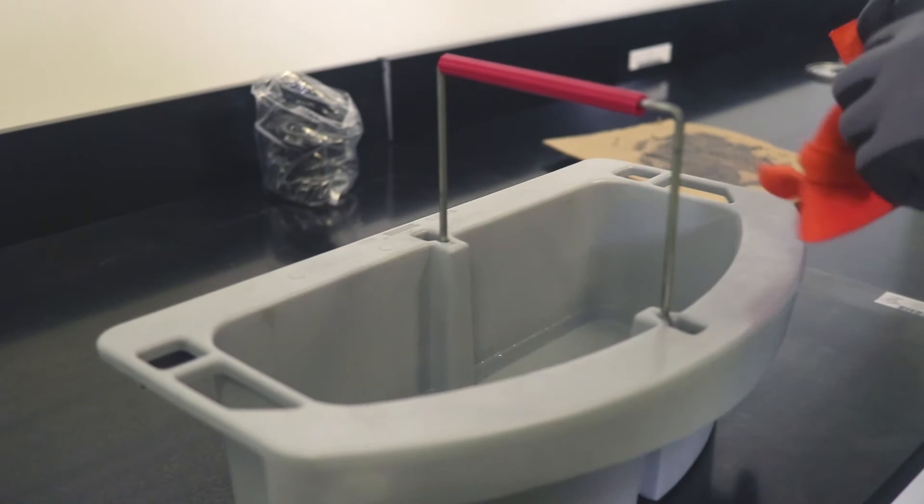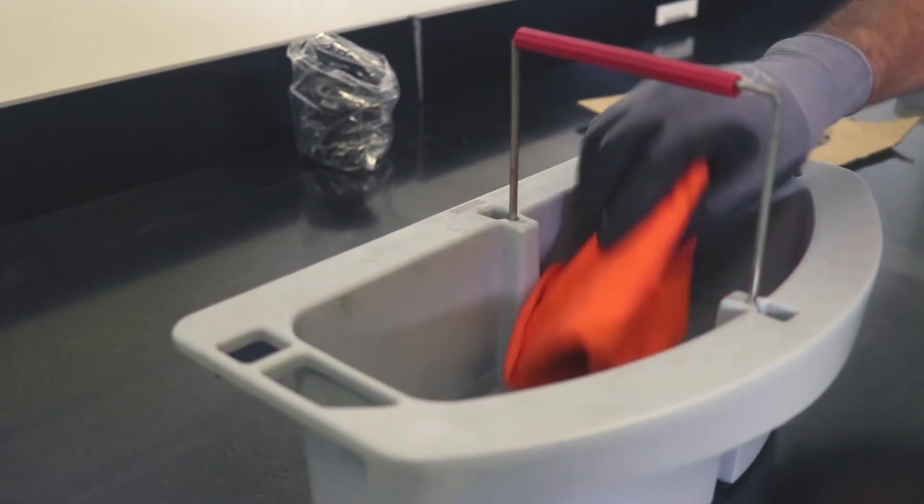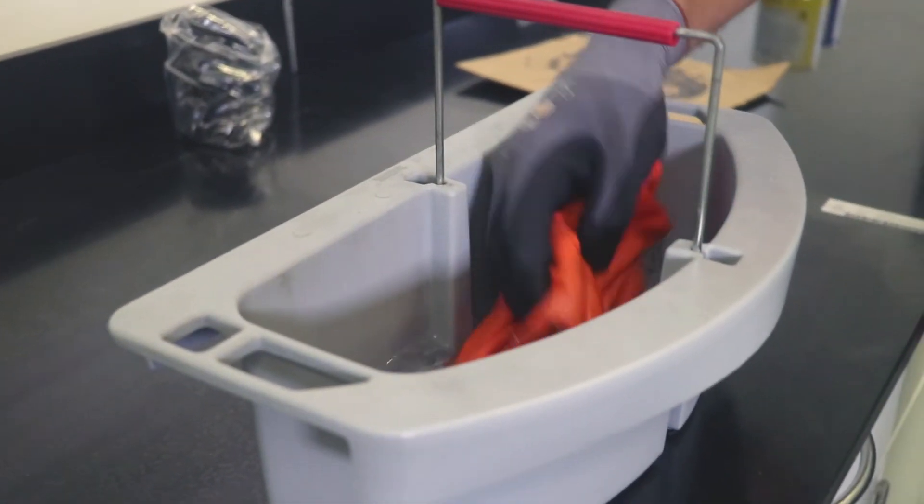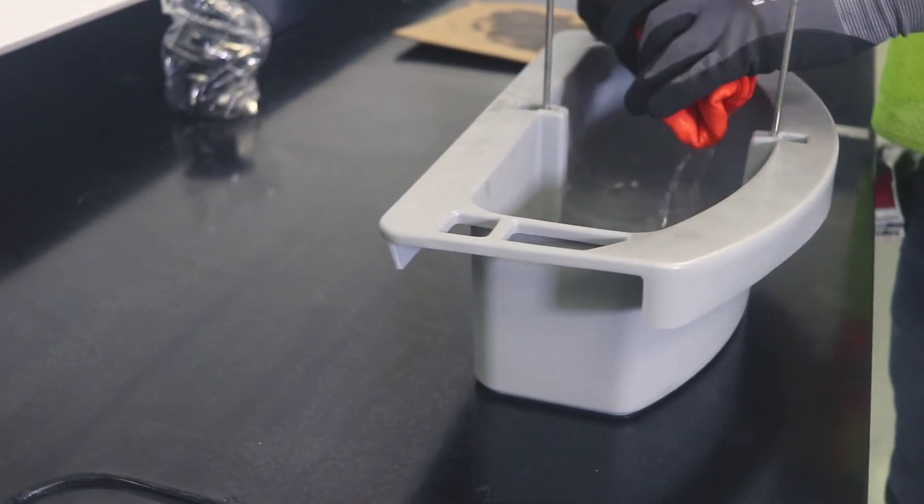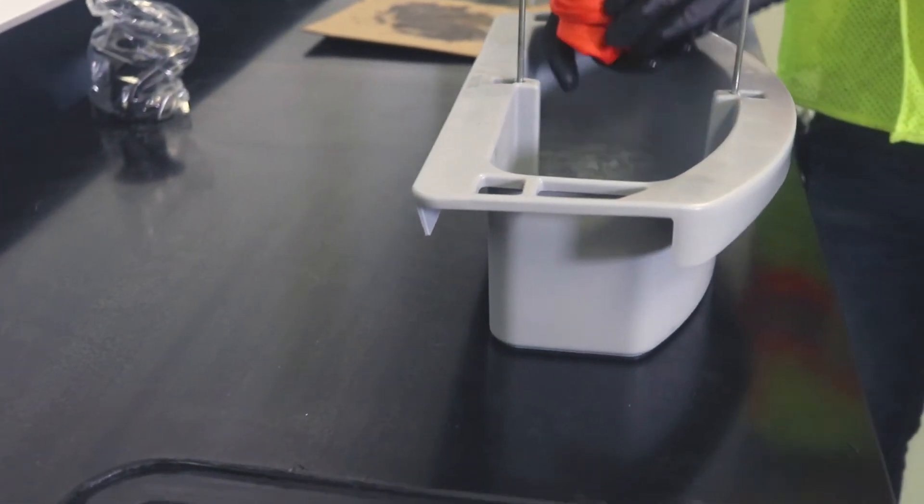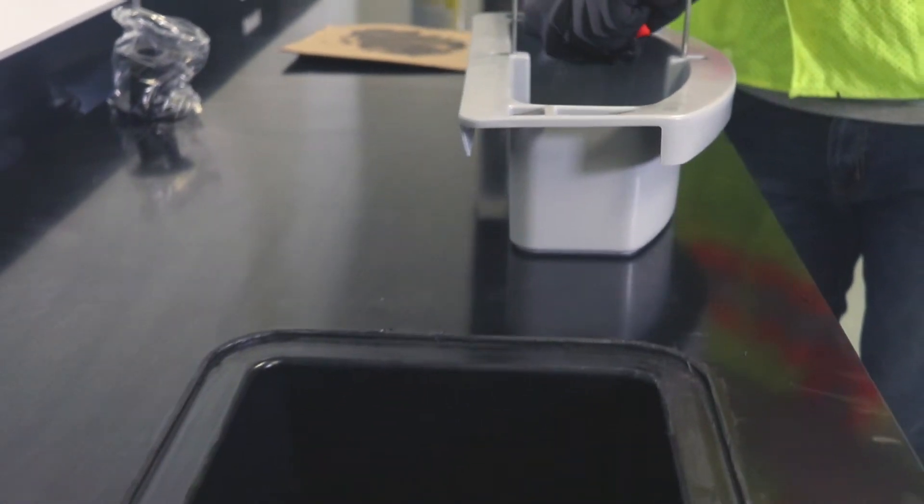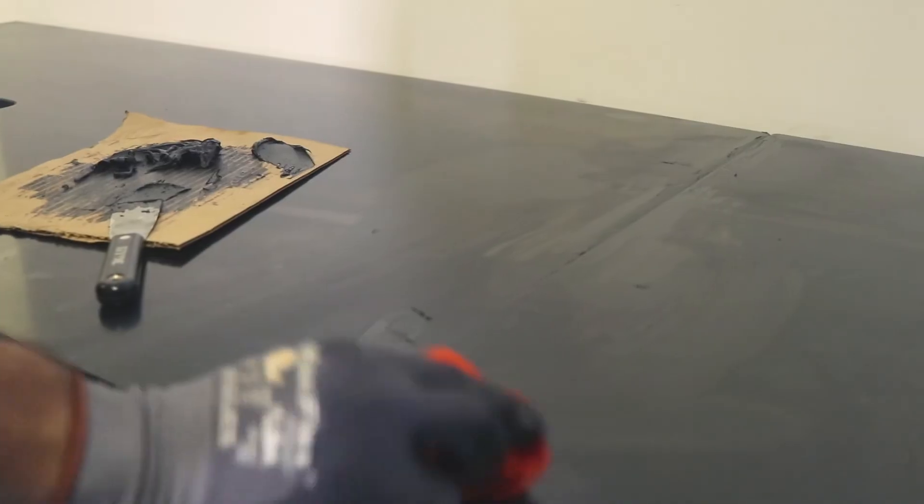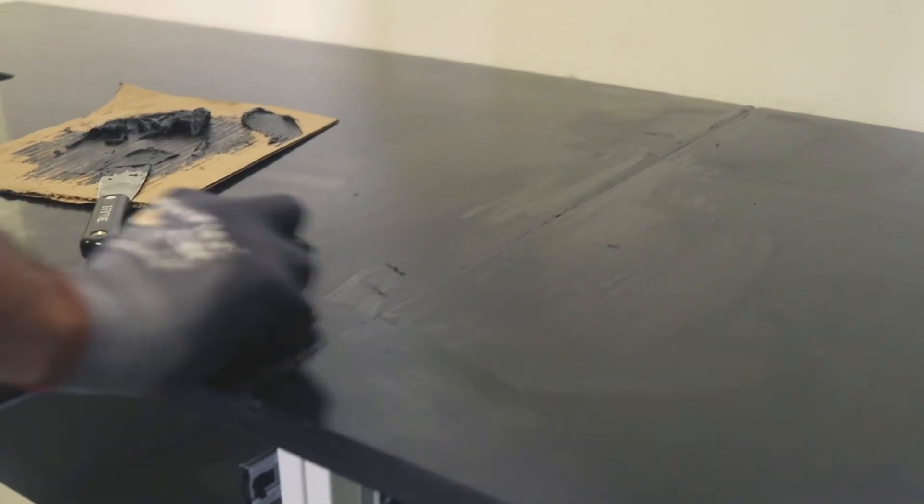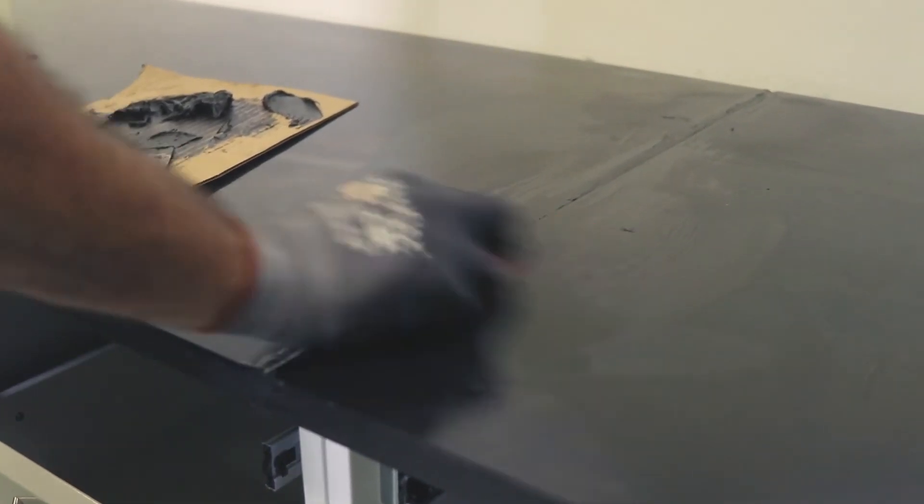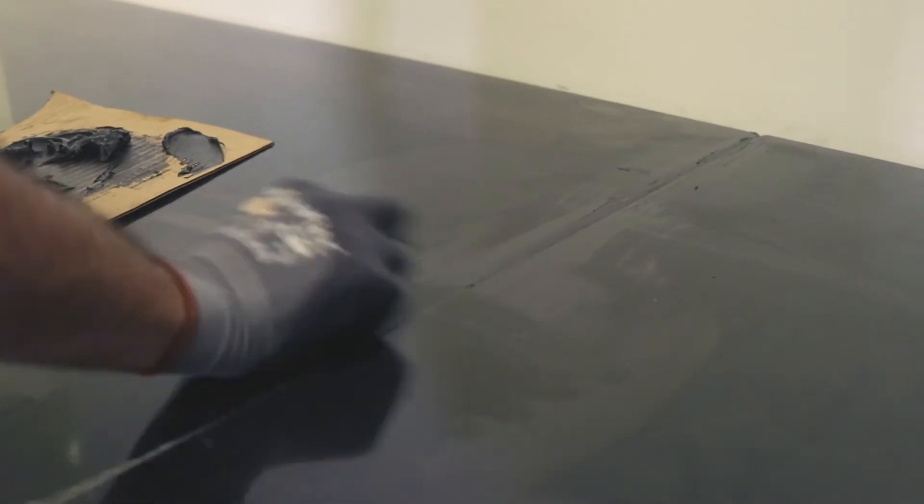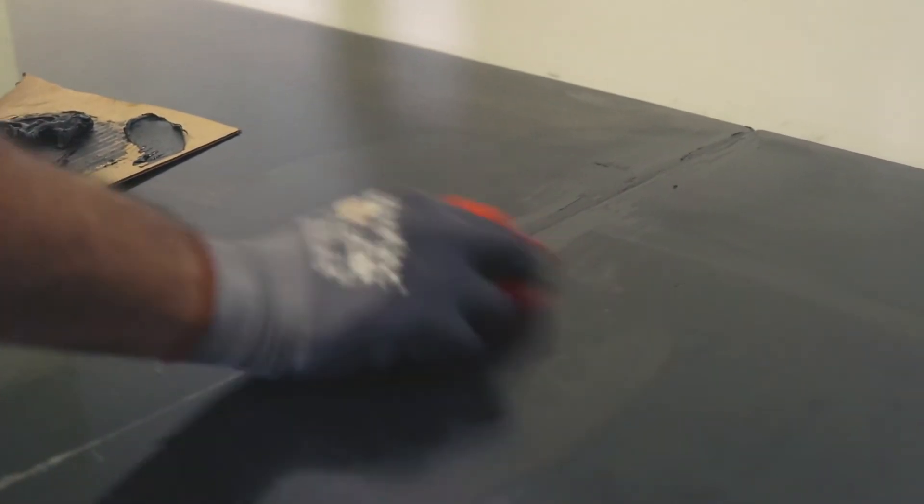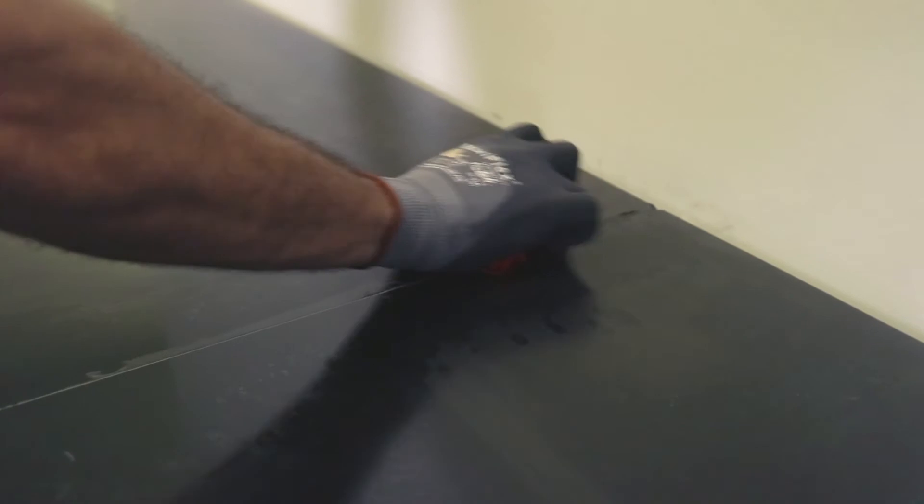Be sure to have a cloth with a bucket of dirty water and a cloth with a bucket of clean water to clean the epoxy residue. Constantly change the water so that the surfaces are clean when they dry. Allow the epoxy to dry for three to four hours.